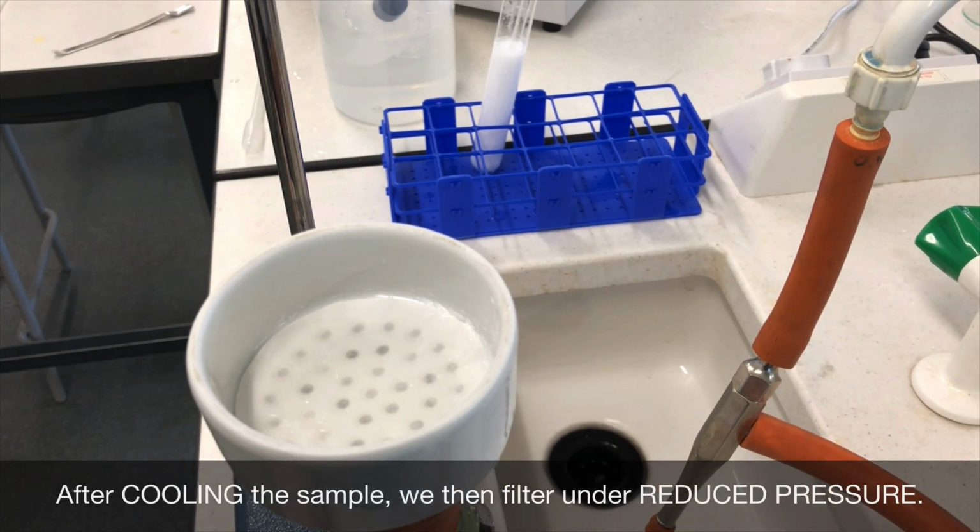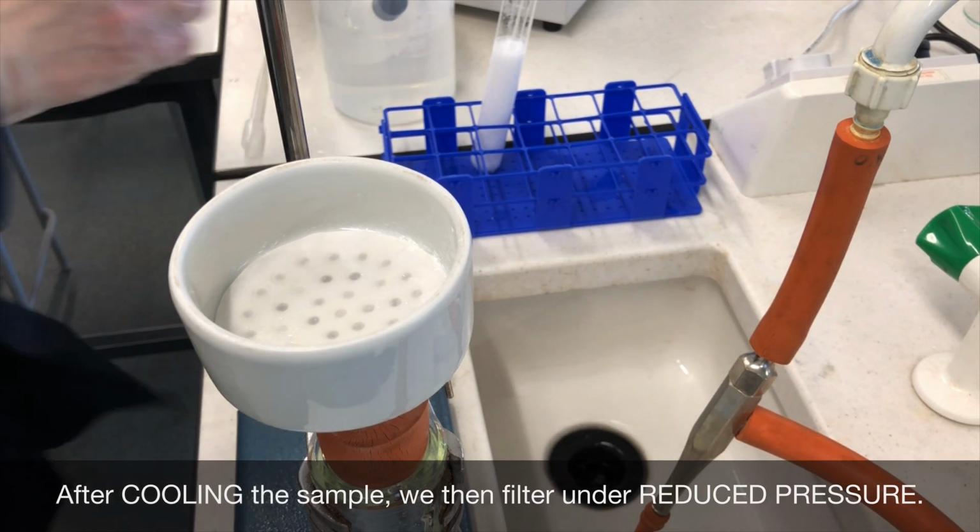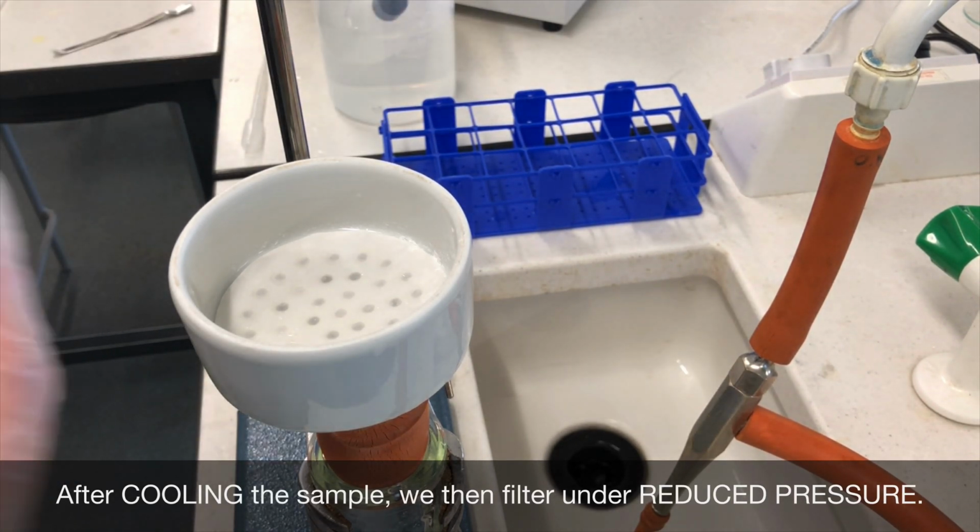Once the sample had dissolved in the minimum amount of hot solvent, I very quickly cooled it in an ice bath. This allowed the solid to recrystallise.